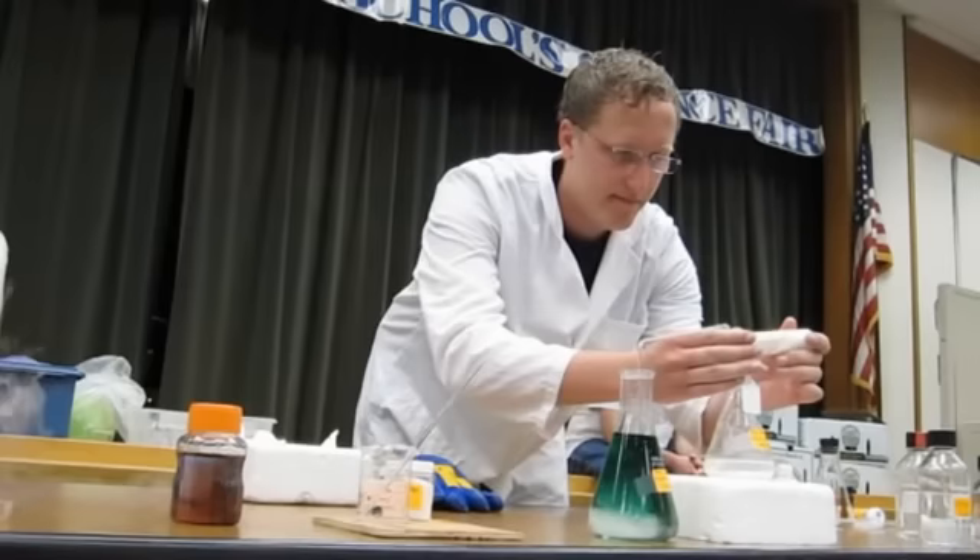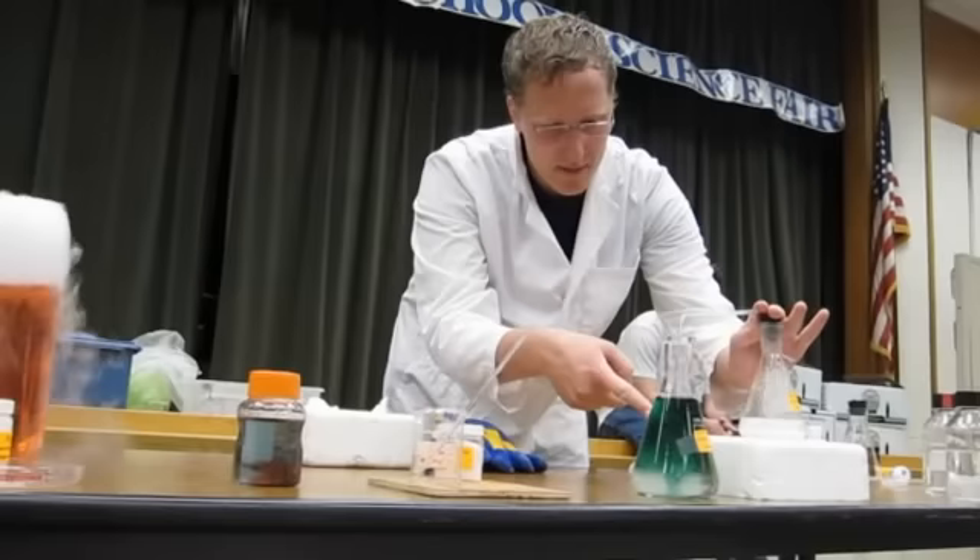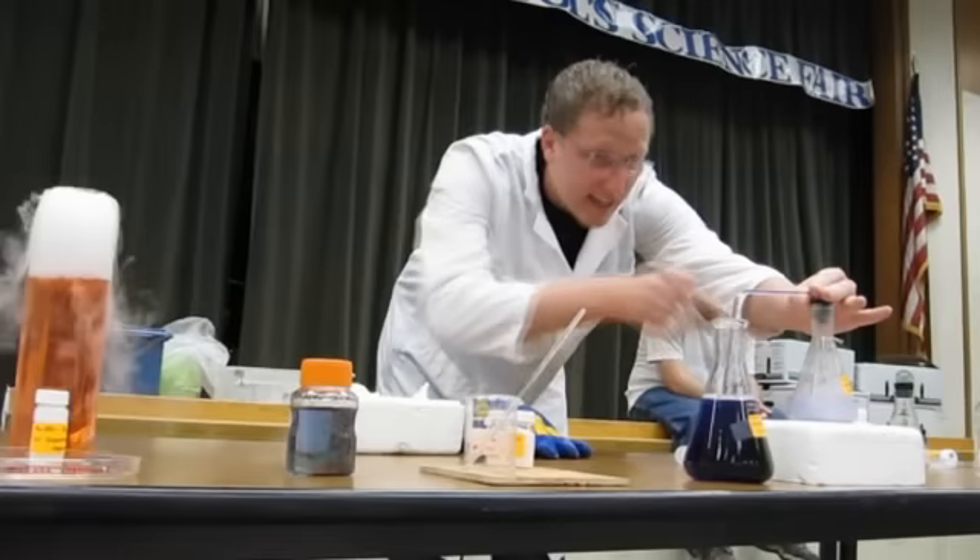This is very fast, so bear with me and check this out. Check the bubble in here — can you see it? Yes, and now it's going back. So this potassium hydroxide reacted with the ammonium chloride.